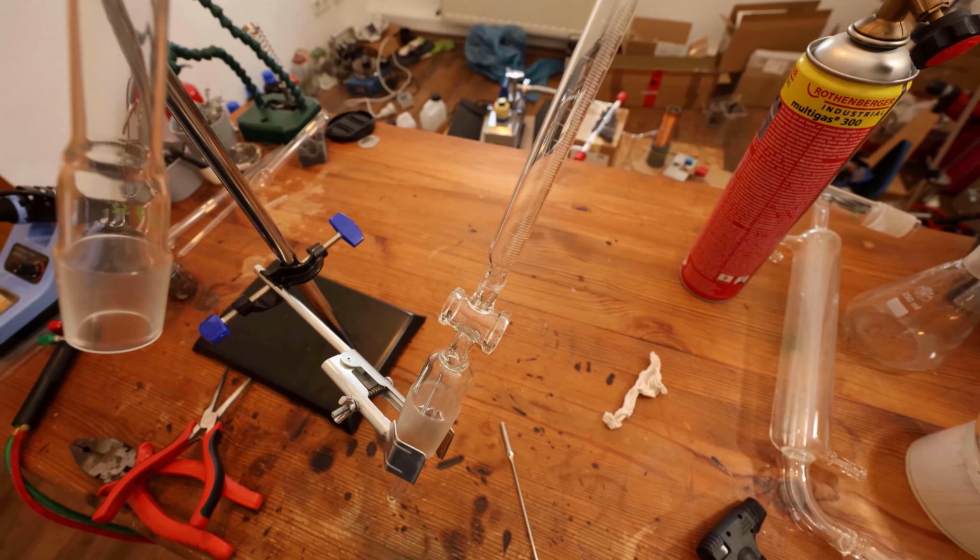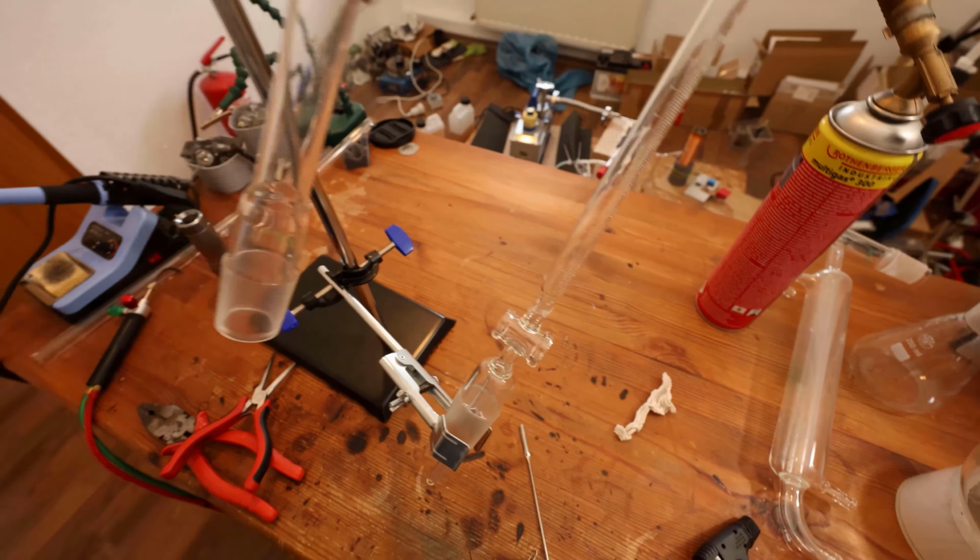I would like to sincerely apologize for the terrible job I've done connecting this, but you know, it works and that's what matters.